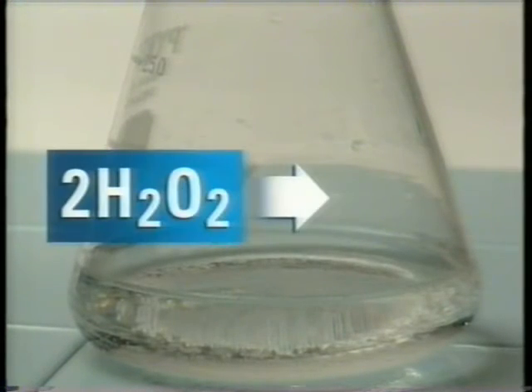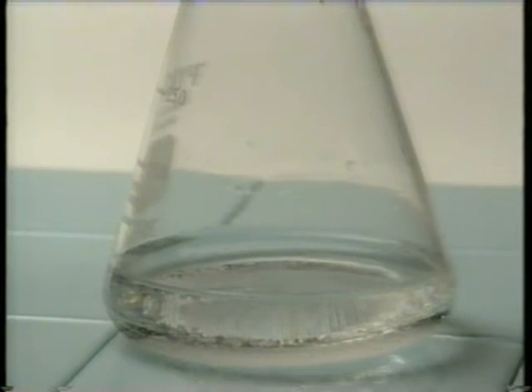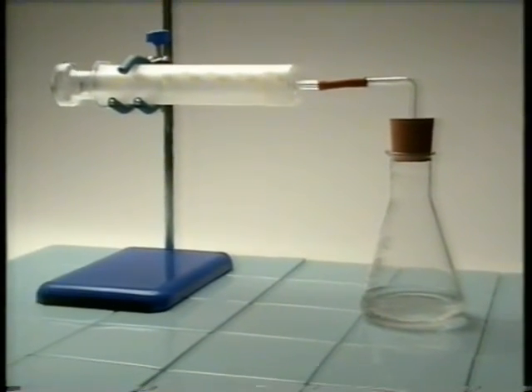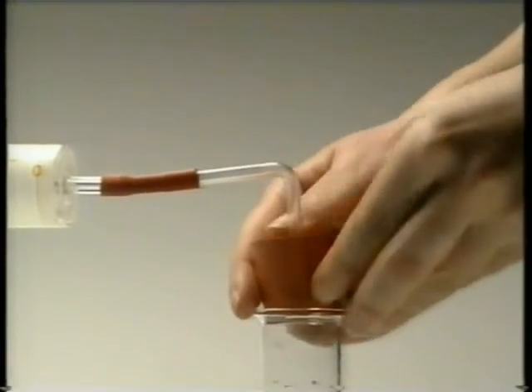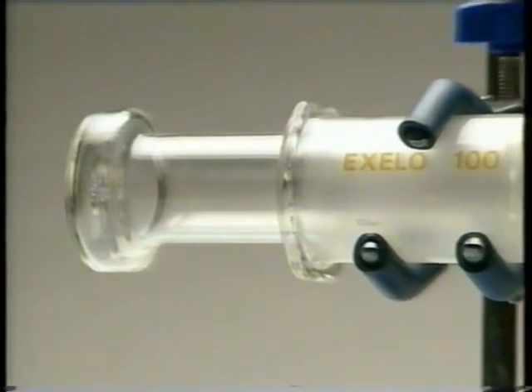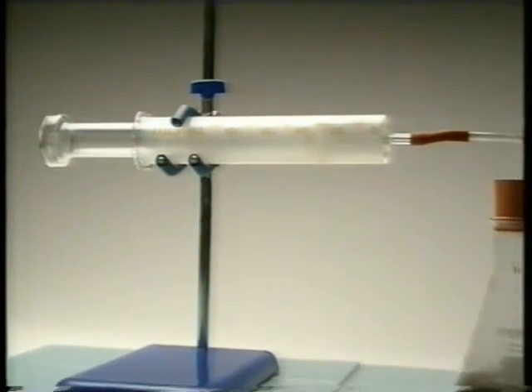This is hydrogen peroxide. It slowly decomposes to form water and oxygen. Any oxygen produced will be collected in the syringe, but at room temperature the reaction is so slow you'd think nothing was happening. One way of speeding up a reaction is to add a catalyst. Add manganese dioxide and the hydrogen peroxide quickly decomposes, producing oxygen. But is it the best catalyst for the job?